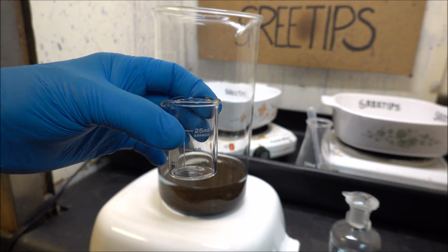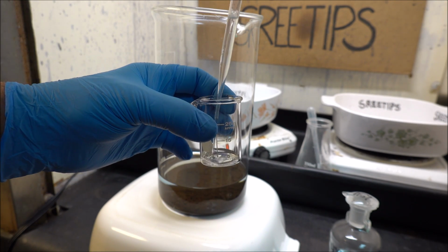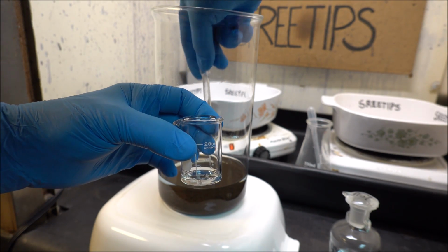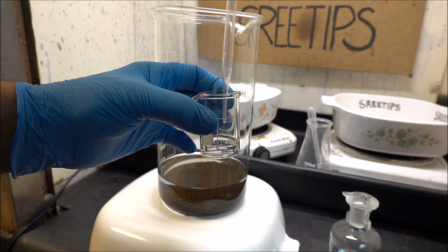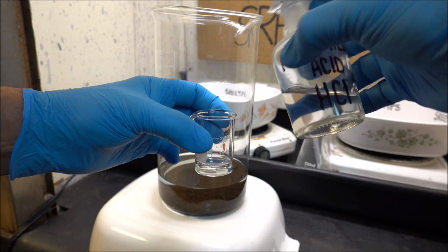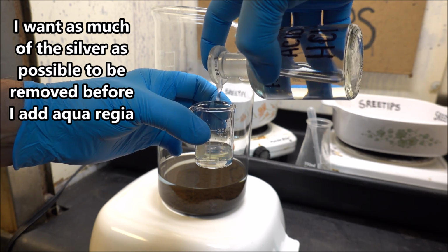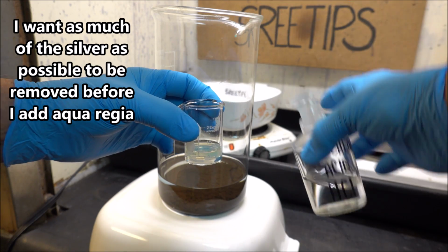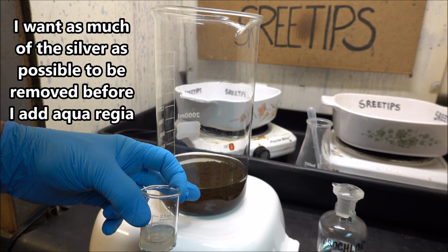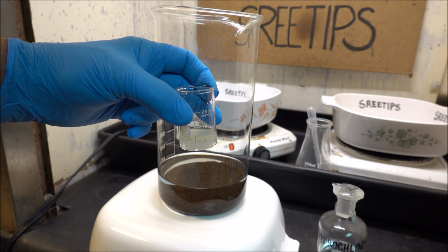We've got to wait for everything to settle out before we can proceed. The main problem here is this solution is going to have silver in it, and it's mingled and co-mixed with the powdered gold. And so what we want to do is get this silver out of here before we go to aqua regia. Put some hydrochloric acid here now, and you'll see that a cloud of silver chloride will form. And we want to get all that silver out of this liquid before we put this gold in aqua regia. That's the problem we're trying to solve here.